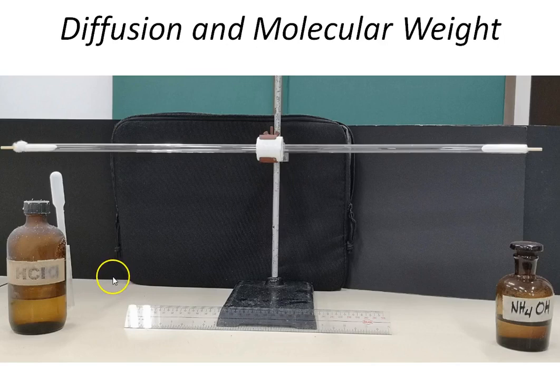So in case in the future you directly handle these two reagents, remember to be careful, and always ask your professor where to place the discarded material, so that you would not accidentally discard it in the general waste bin. That's a very important safety precaution in the laboratory.